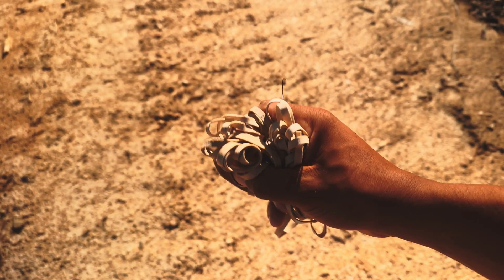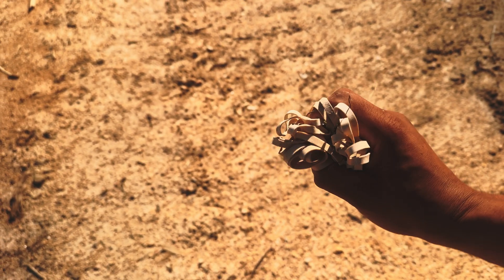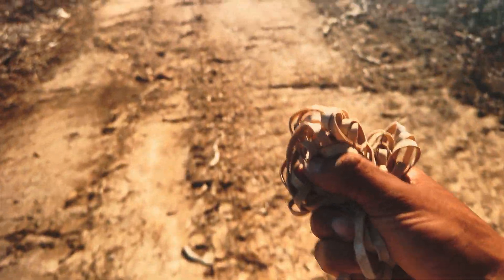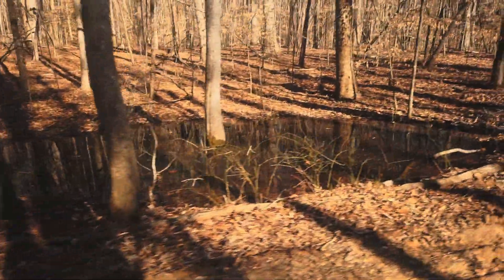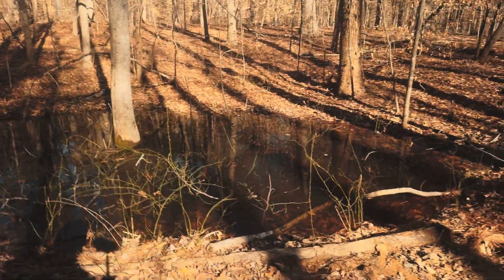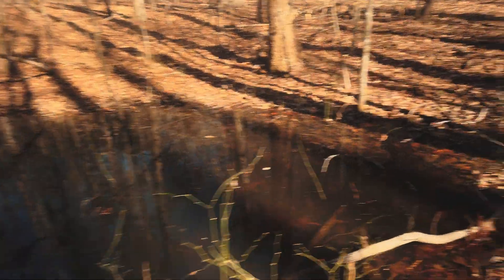Walking this road, I found all of these rubber bands just lying on the ground. Maybe that's why the water quality is not that great — people don't know how to leave no trace. The last little bit of water — whoa, frogs are hopping in that joint. A lot of bugs. Last little bit to test right here. This water is dark too.